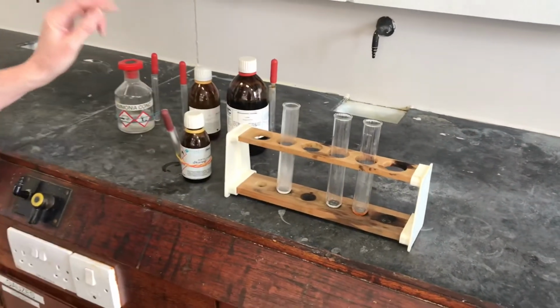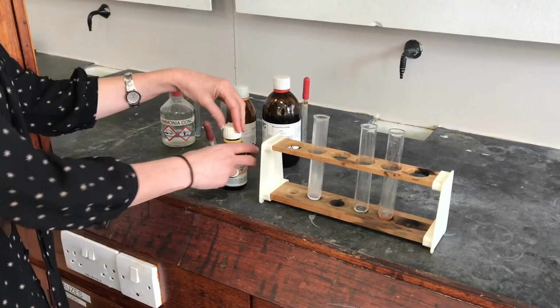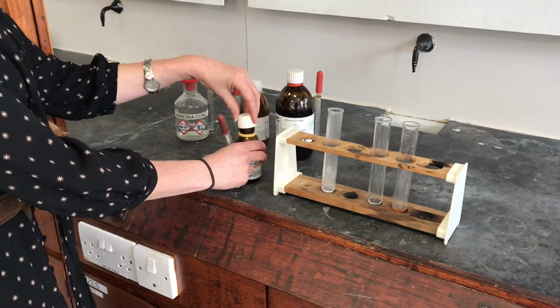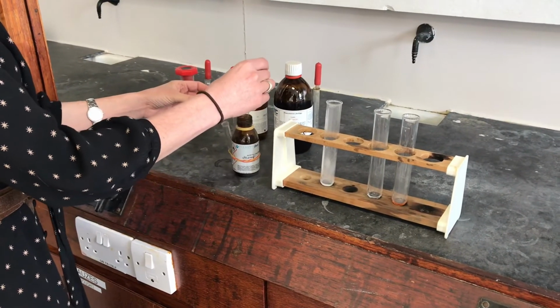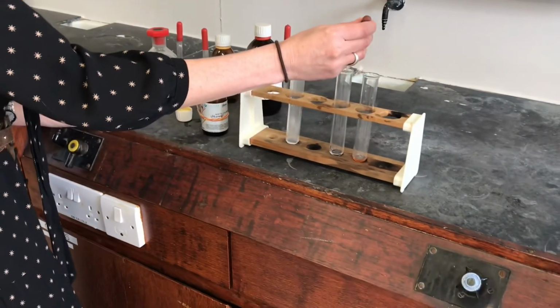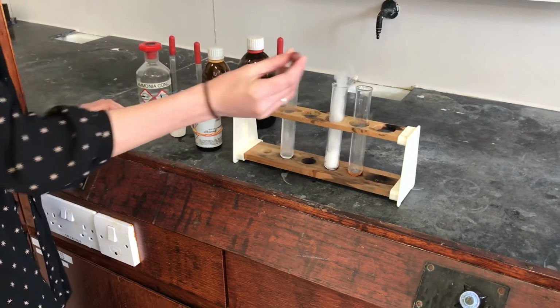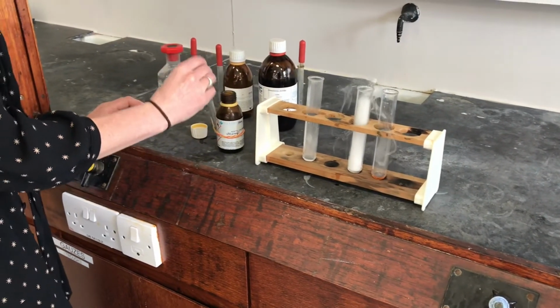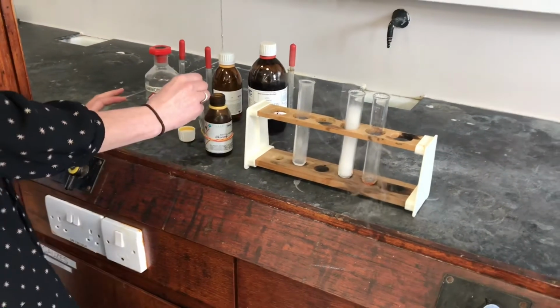Okay, I'm going to try now adding some acid chloride, some ethanoyl chloride to the next one, to the butylamine, and I want you to compare how vigorous the reaction is. So I'm going to be really cautious with this one, just one drop. Crikey, it makes me jump every time. I don't know if you heard that hissing and sizzling. Let's try adding another drop.